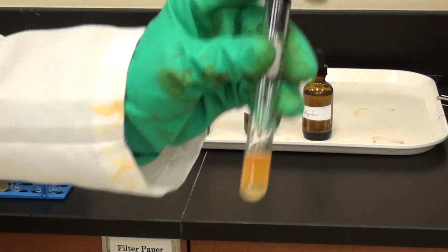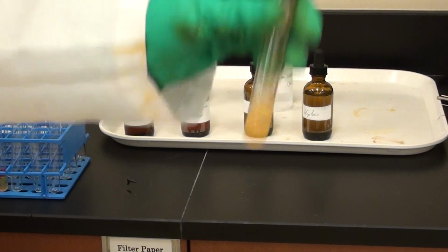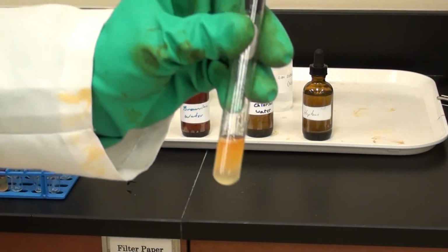Now I noticed this particular test tube is a little bit bigger than the others. Could you put it down the camera a bit? Just don't let the stopper fall all the way through. Yeah, make sure you're using the appropriate size stopper. Okay, go ahead and put that down in the camera a bit more.